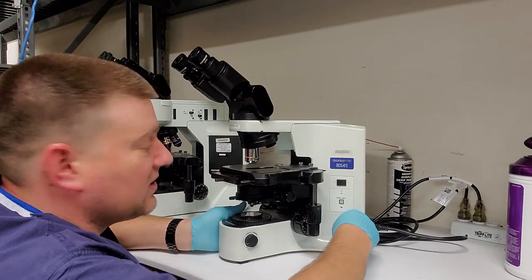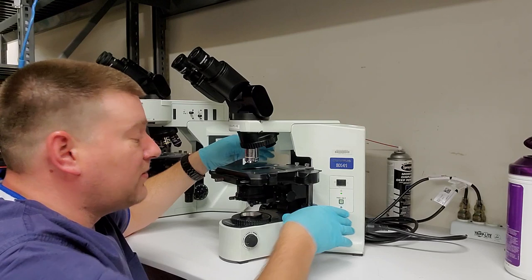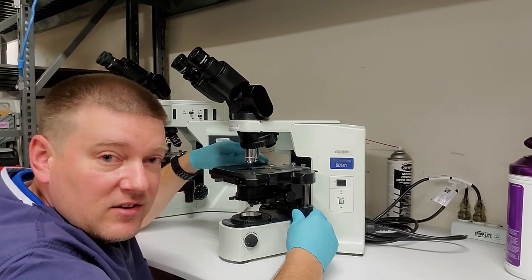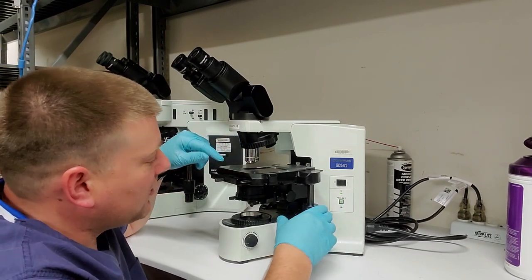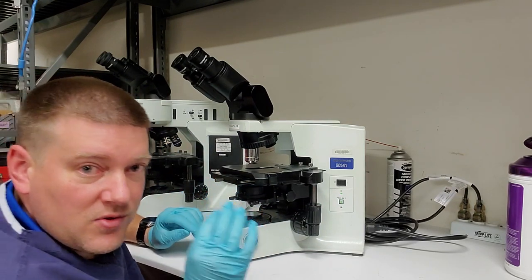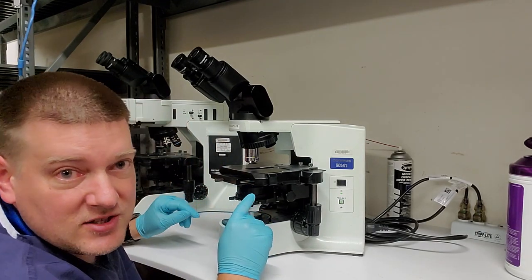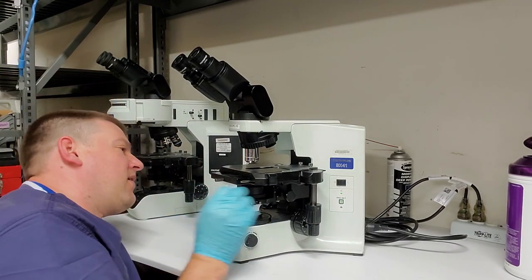Now we want to take a look at the stage. So I want to move it throughout its range, to and fro, make sure that nothing's dragging, no grinding sounds. We want to check for debris. Now these two right here, these V grooves, they're called the ways, okay? And you want to check and make sure that there's lubrication on those ways. Do not let your ways dry out.